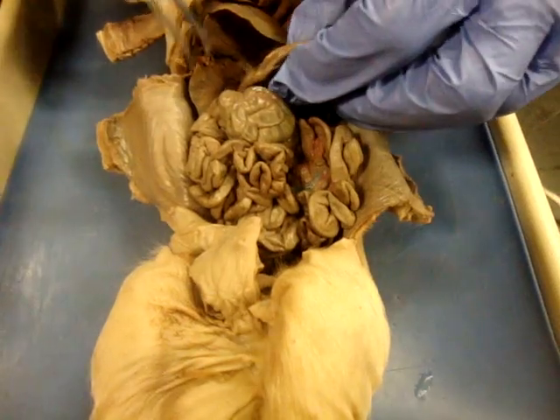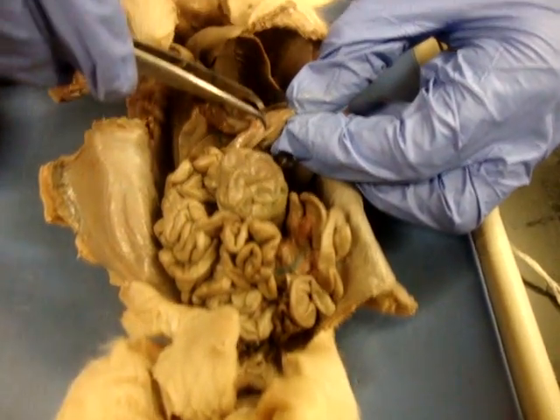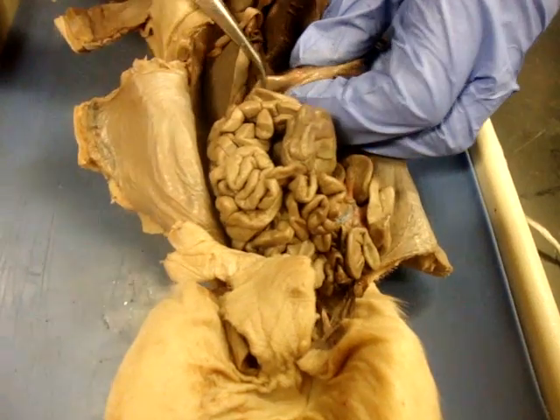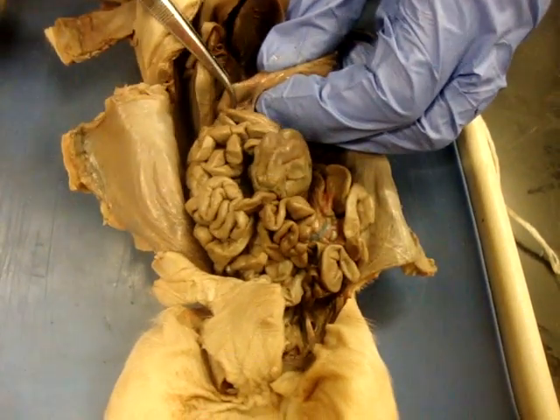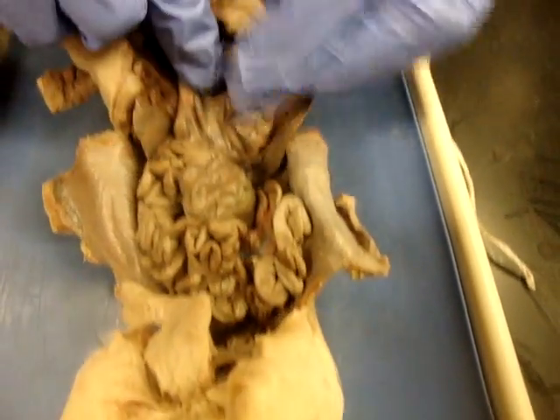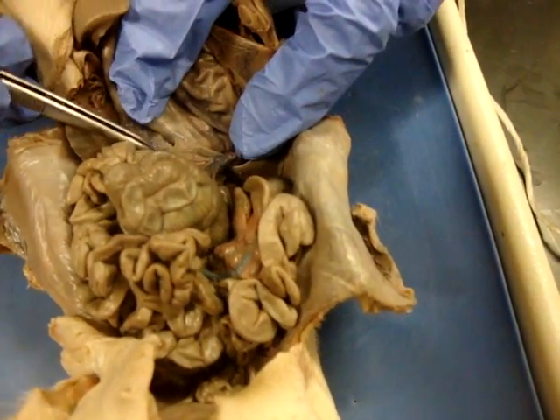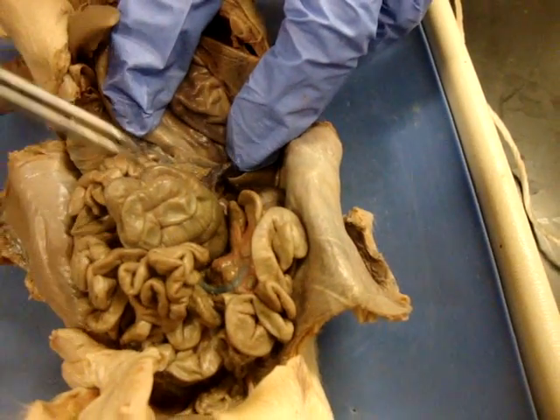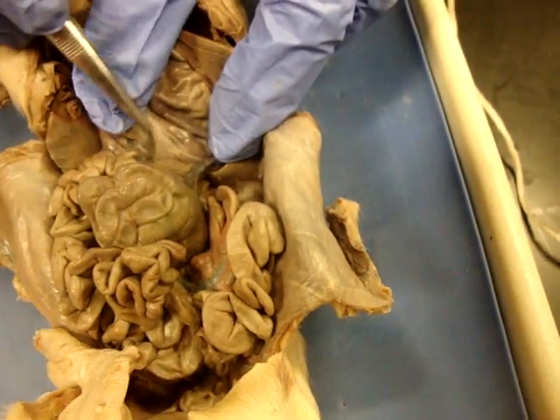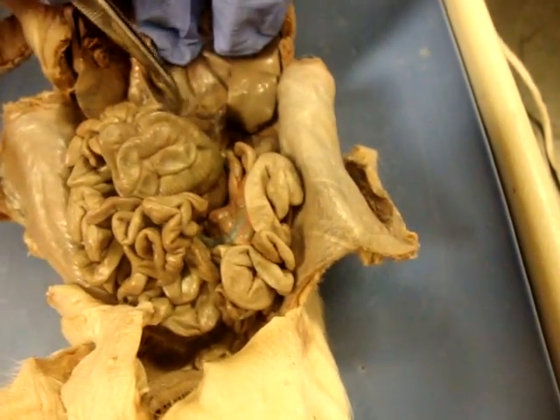From the stomach, we can also follow it in the other direction and find that we have a pyloric sphincter right here. There's a lot of muscle in there. And then directly after that is the first part of the small intestine — this is the duodenum, that very first part extending from the stomach. If we lift the stomach up, we will find underneath it the pancreas. The pancreas is this structure right here, and it's going to look a lot more like a gland because of that weird mottled appearance. You find your stomach, lift it up, and you'll always find the pancreas right underneath it.